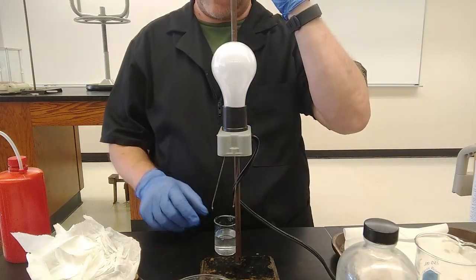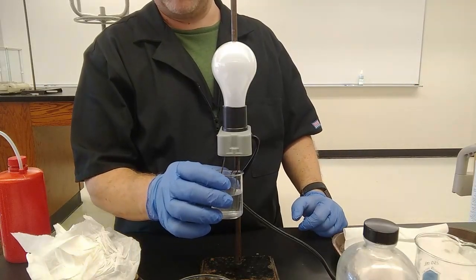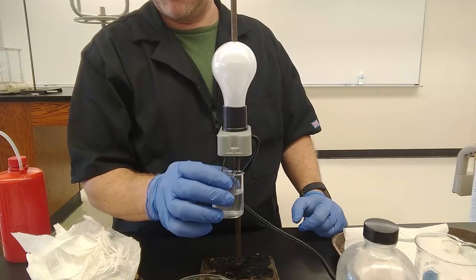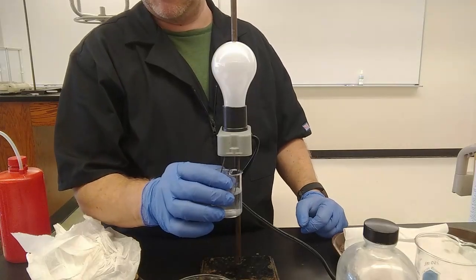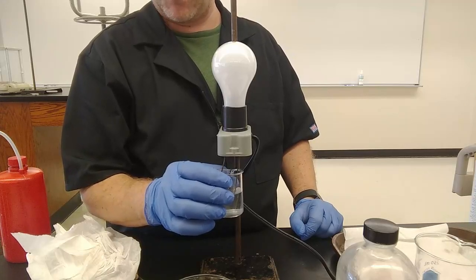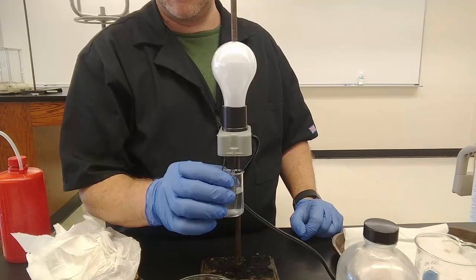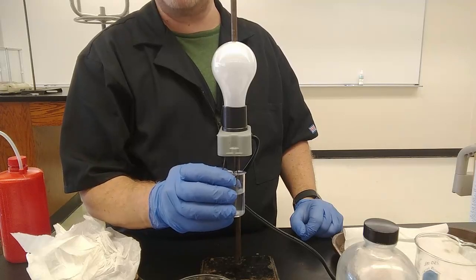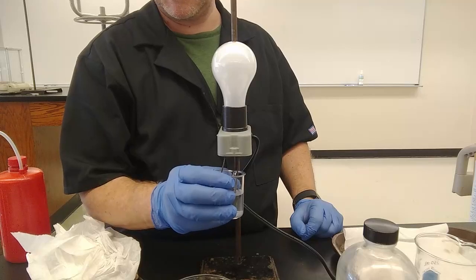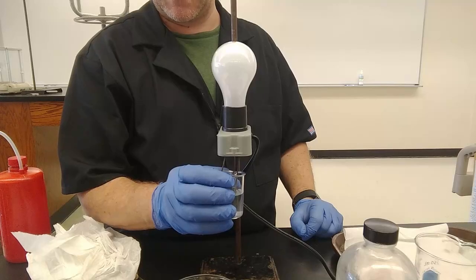I have a line through the end because it just doesn't dissolve in water. Okay? Magnesium hydroxide, actually I'm going to take it out for the next edition of the lab manual. But magnesium hydroxide doesn't dissolve in water, unlike calcium hydroxide, which does dissolve in water. So this slurry doesn't conduct. Does that mean it's a non-electrolyte? Absolutely not. That's why I put the line in the last column. It's an ionic compound, to give you the answer to the first column, but it doesn't dissolve in water.